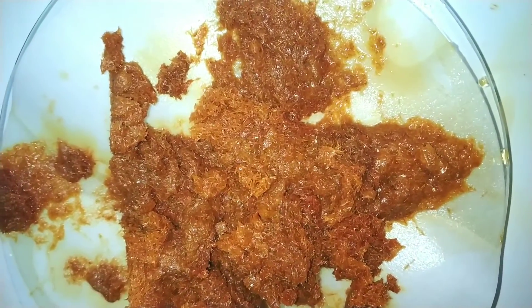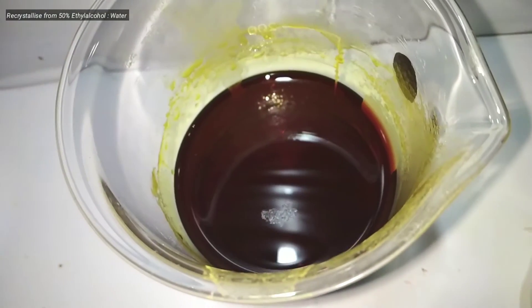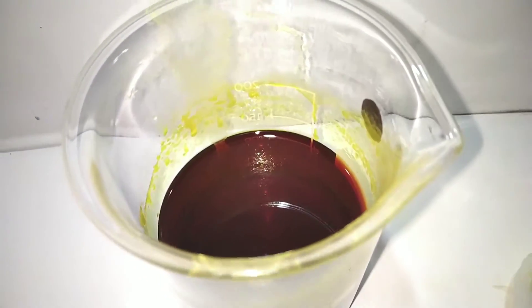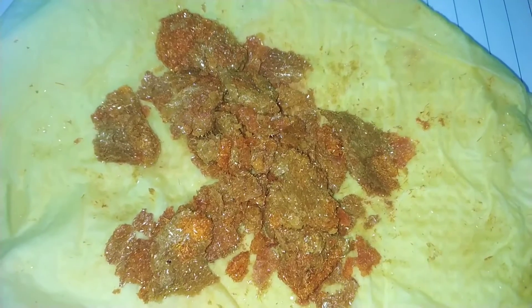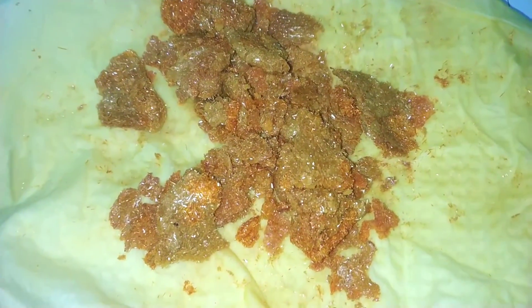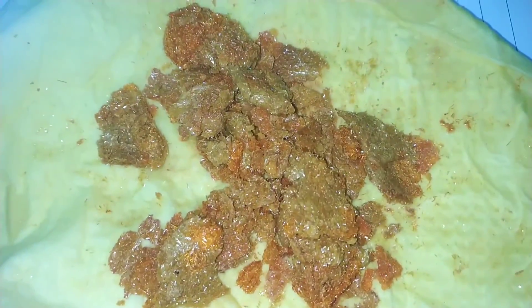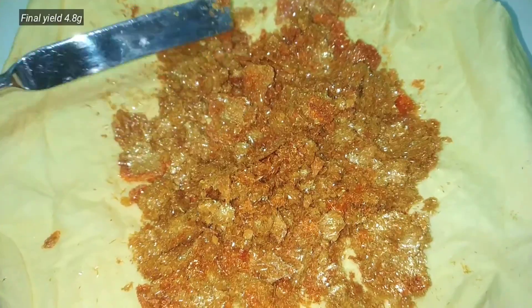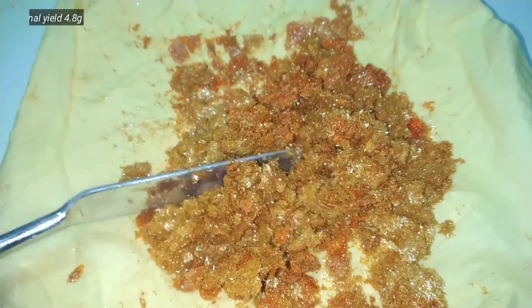Recrystallization was carried out using a 50% ethyl alcohol and water mixture. I used around 200 ml of this mixture, which means about 100 ml ethyl alcohol and 100 ml distilled water. On cooling, the crystals were obtained, filtered, and this is the purified product. The final yield was around 4.8 grams, which is almost equal to the theoretical yield of paranitroaniline.